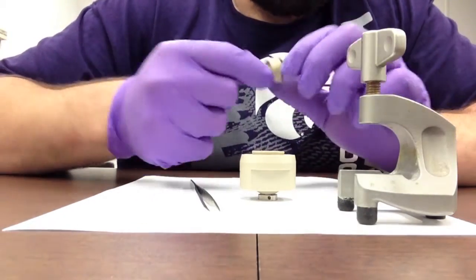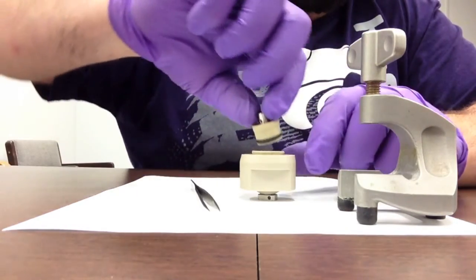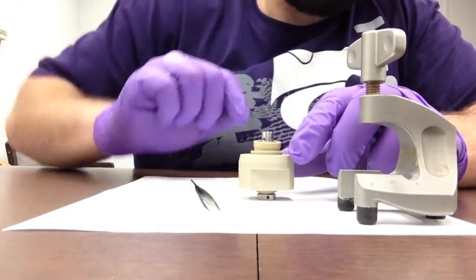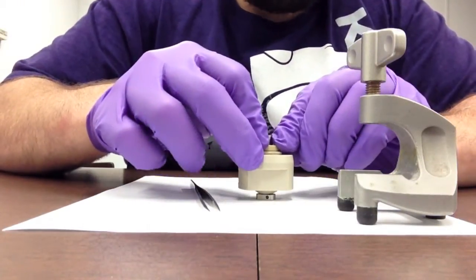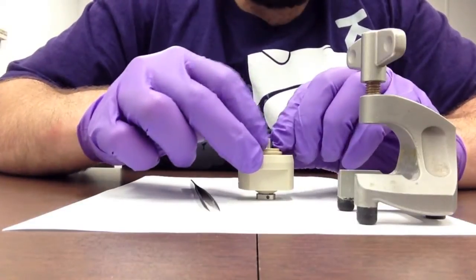When we've all assembled, we can take the piston and place it into the sleeve, and this is where you're going to have to forcefully push a little pressure to get it all to seat properly.